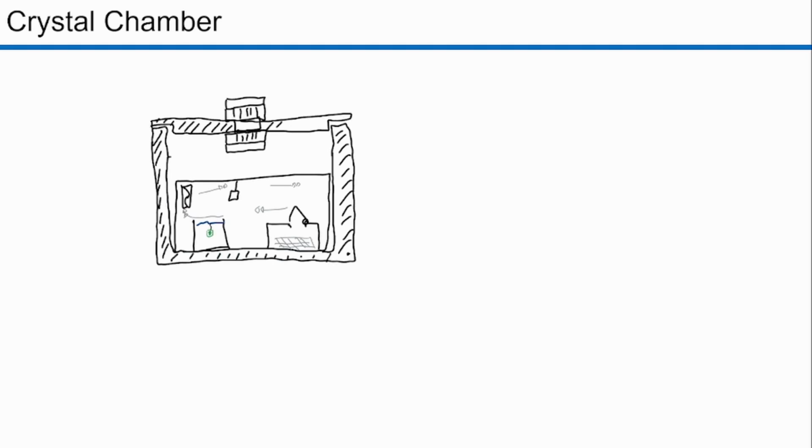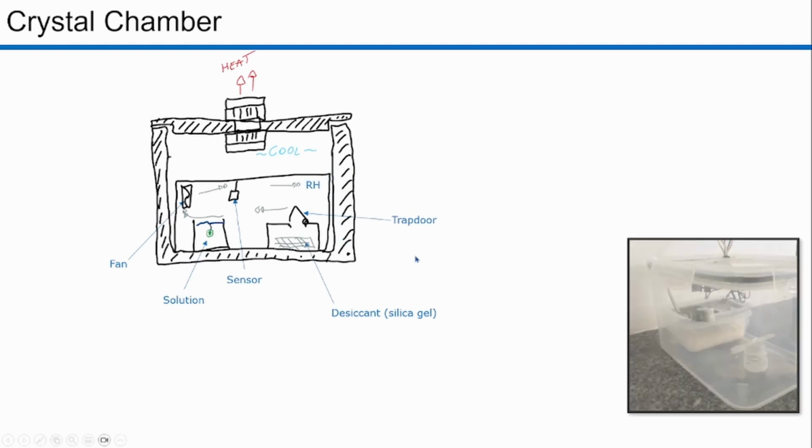Right, for more advanced control, I developed this machine that I call the crystal chamber. So considering all the variables that we talked about, I made this schematic here where we have the solution in a closed environment. There's the desiccant, in this case silica gel. There's a trapdoor to regulate how much air comes into the desiccant chamber and gets dried out. So if I need more dryness, I would open the trapdoor. If I need a slower evaporation, I would close the trapdoor. There are some temperature sensors, a fan for air uniformity, and this is airtight. It's that arrangement from before, but without the servo and the scale. In this case, just the solution, the vessel, and everything else.